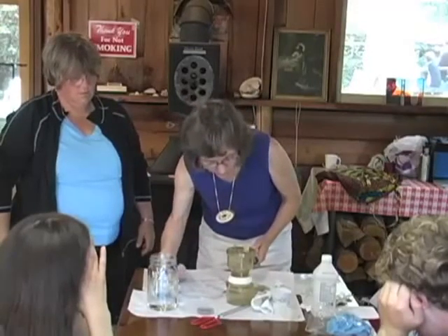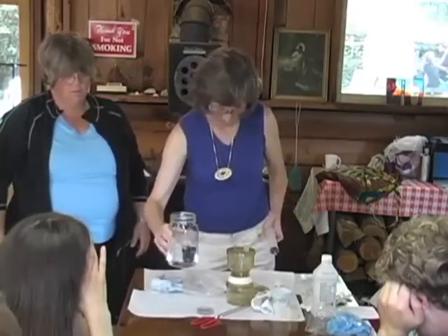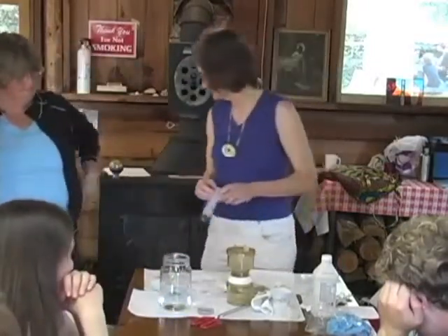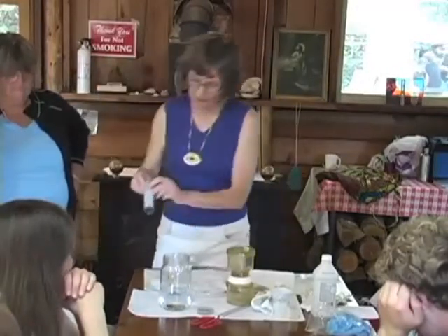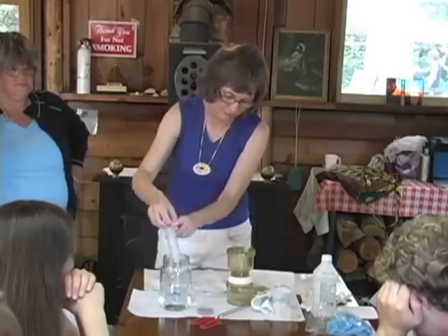Shake the sample bottle well. We would shake it well. Okay. Using a sterile syringe, add the desired amount of the water sample into the filtration unit through the top. Okay, now as long as I haven't touched the tip or the inside, I'm okay. And I'm going to draw 50 mils for now, 50 cc's.